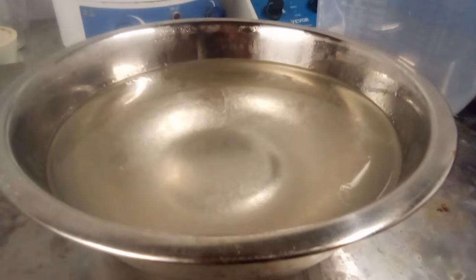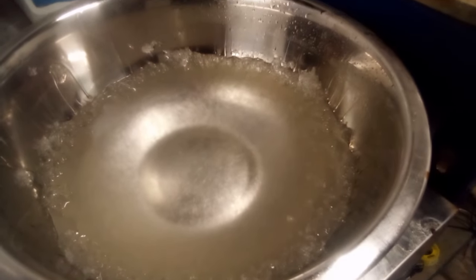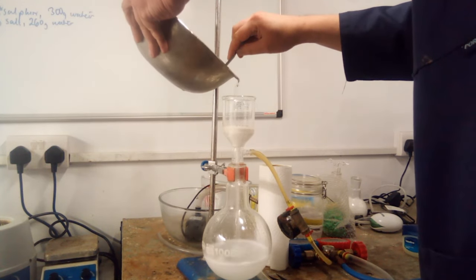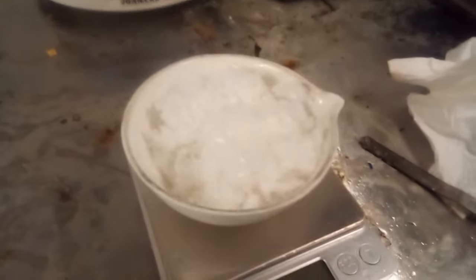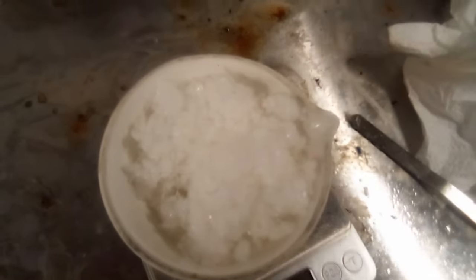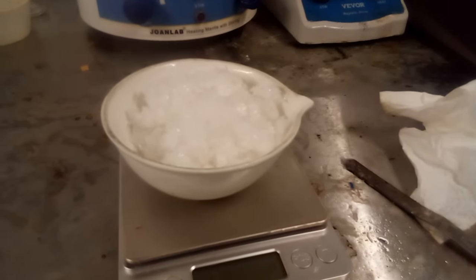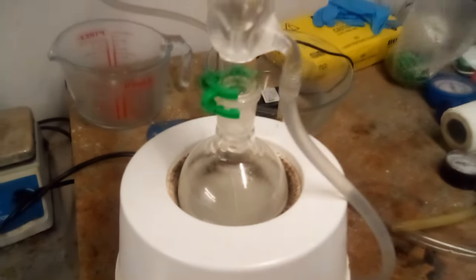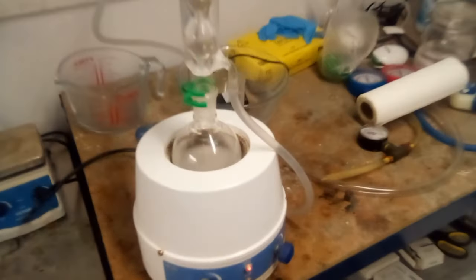After 2 days I had a mass of fine transparent crystals that was not so much a crystal garden as a crystal black forest. I decanted about half the supernatant fluid into a jug, filtered the rest under vacuum into my biggest round-bottom flask, and left the pump running for another half hour to get the last of the water out. The yield was 57.6g of sodium hydroxylamine disulfonate, which is 49% with respect to sodium nitrite. Brauer cites the expected yield as 50%.